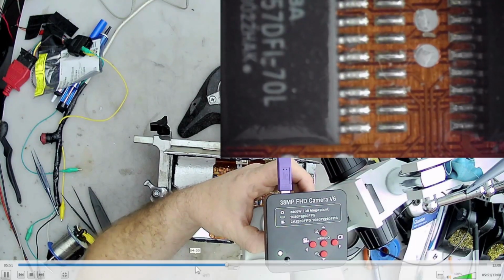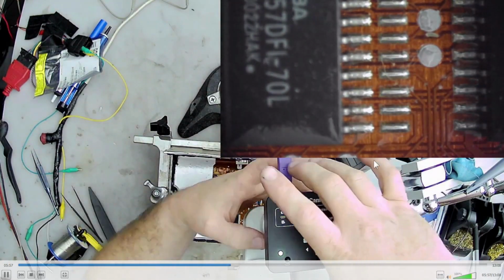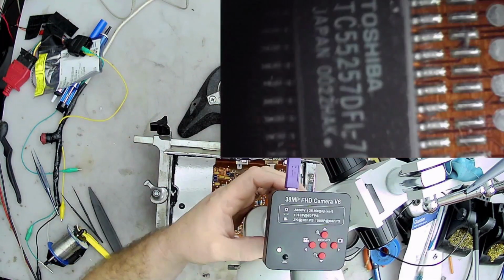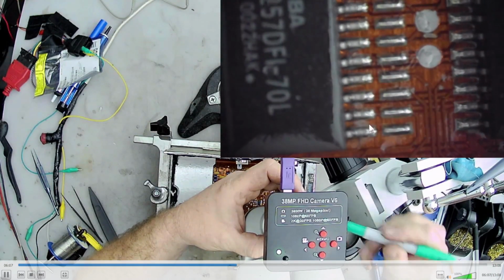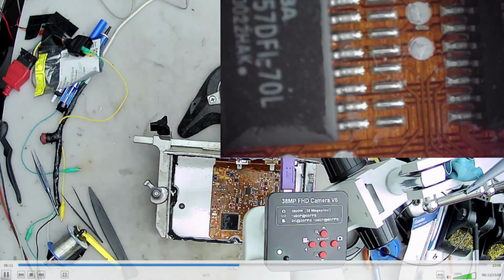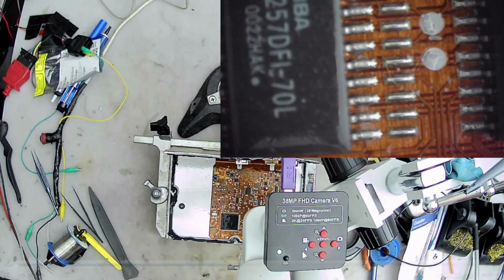And let's see if we can see in the camera. You see there's really no black on the edges, just a little bit of black shadow on the edges here. That's how I know it's lined up pretty good. And I'm not really concerned about the image being straight in the camera, because I'll adjust my camera later. Mostly I'm just worried about the black shadows in the edges. So here I take the marker, I mark them.